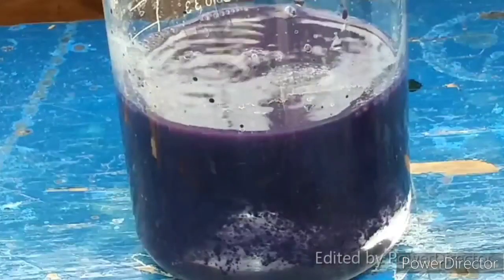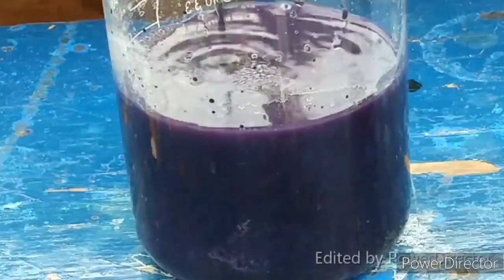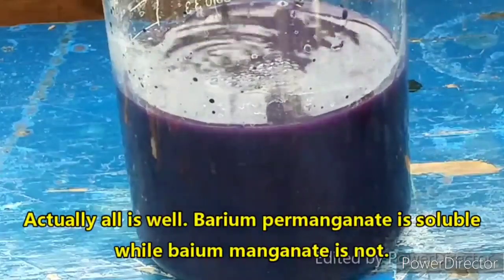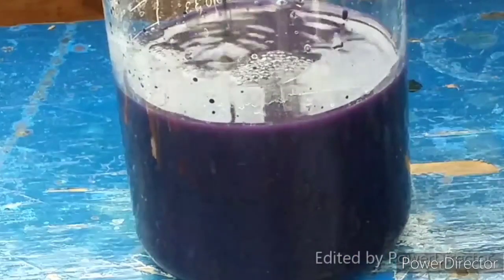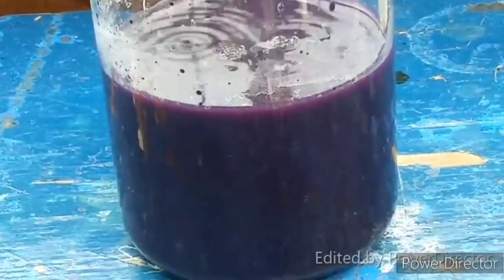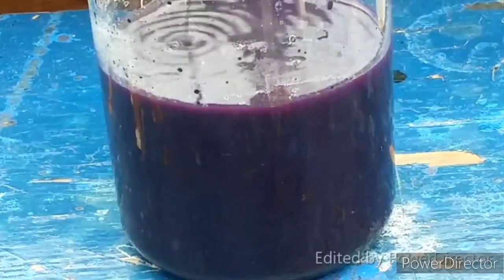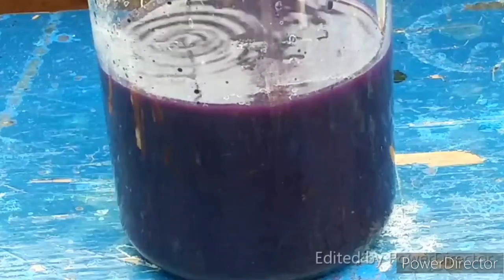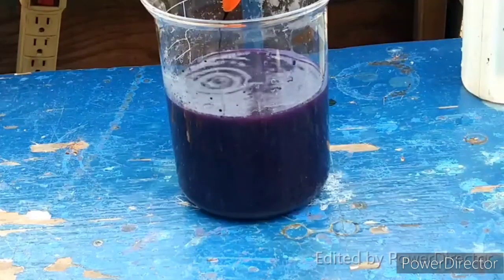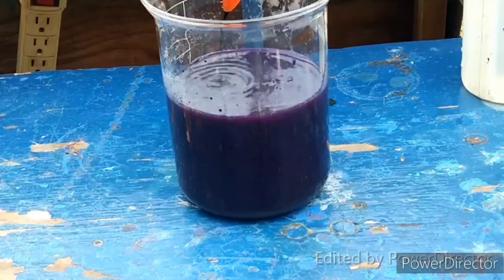That is awesome — that is the wrong color. It might be that a lot of it has become permanganate, but I think we are getting a precipitate of barium manganate on the bottom. As an aside, we found a pretty convenient way to make permanganate too.